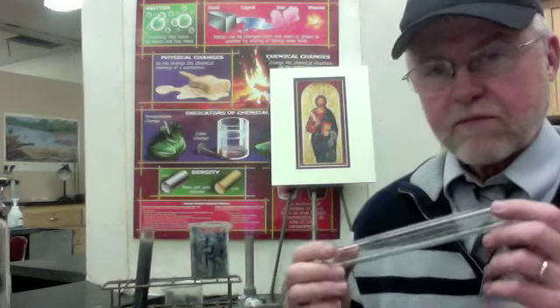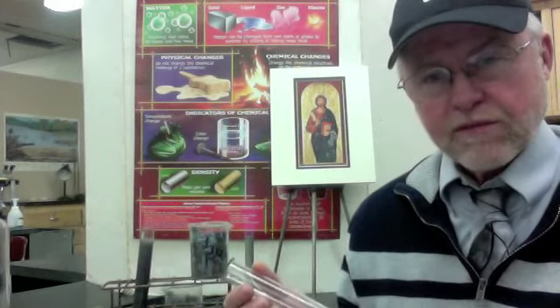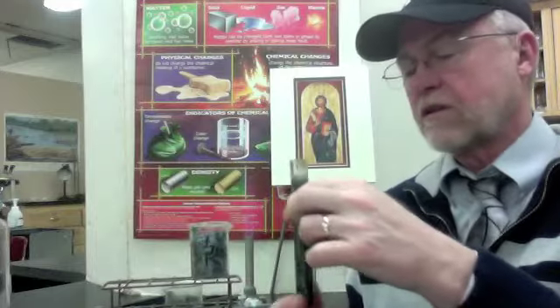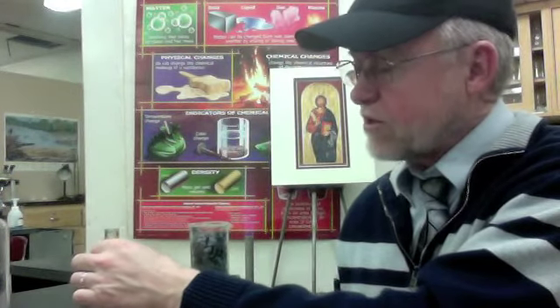I made water. How about that? Now, of course, what state of matter was the water in? Do you see any rain coming out of the tube? And it wasn't liquid, was it? Okay, so we have, oh wait, we've got one more observation left. Whoa, that is hot. This is an exothermic reaction.